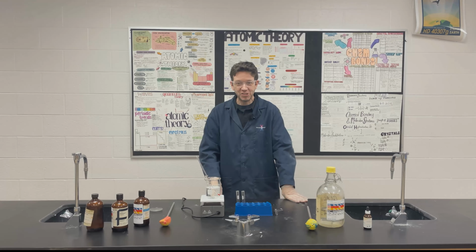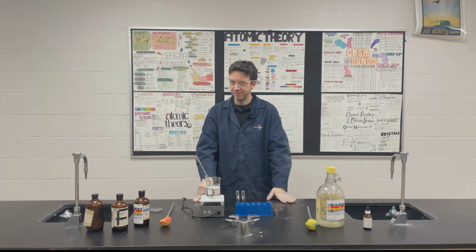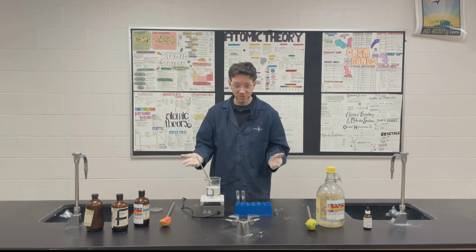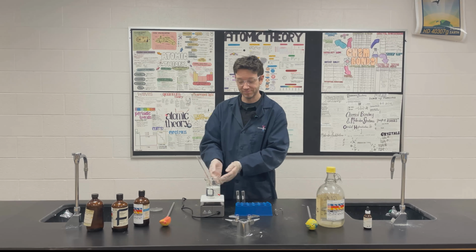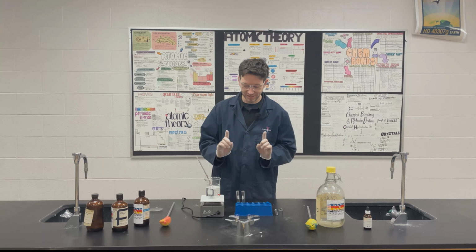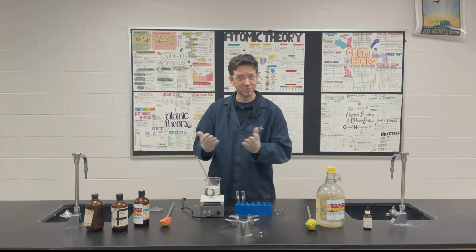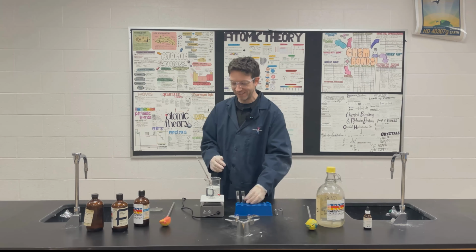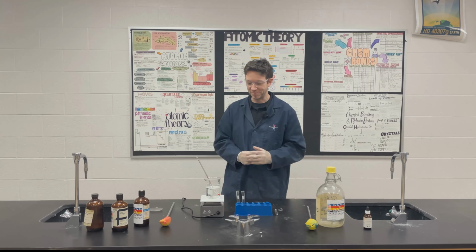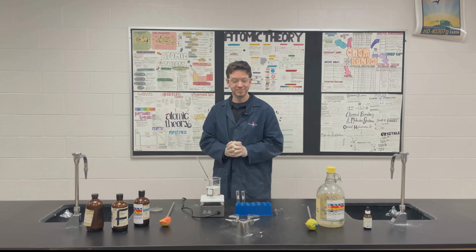Now I'm just going to pause the video here because you want to leave this in your hot water bath between 70 and 80 degrees for about 5 minutes. This is where I usually tell my students to prepare the other ones. Put those into your hot water bath. And also, very important, I'm only doing 1, so I'm not labeling it, but if you're doing all 3, like my students would, I ask them to please label their test tubes so they don't mix up which one is which sample. So that is very important. All right, let's come back in about 5 minutes.